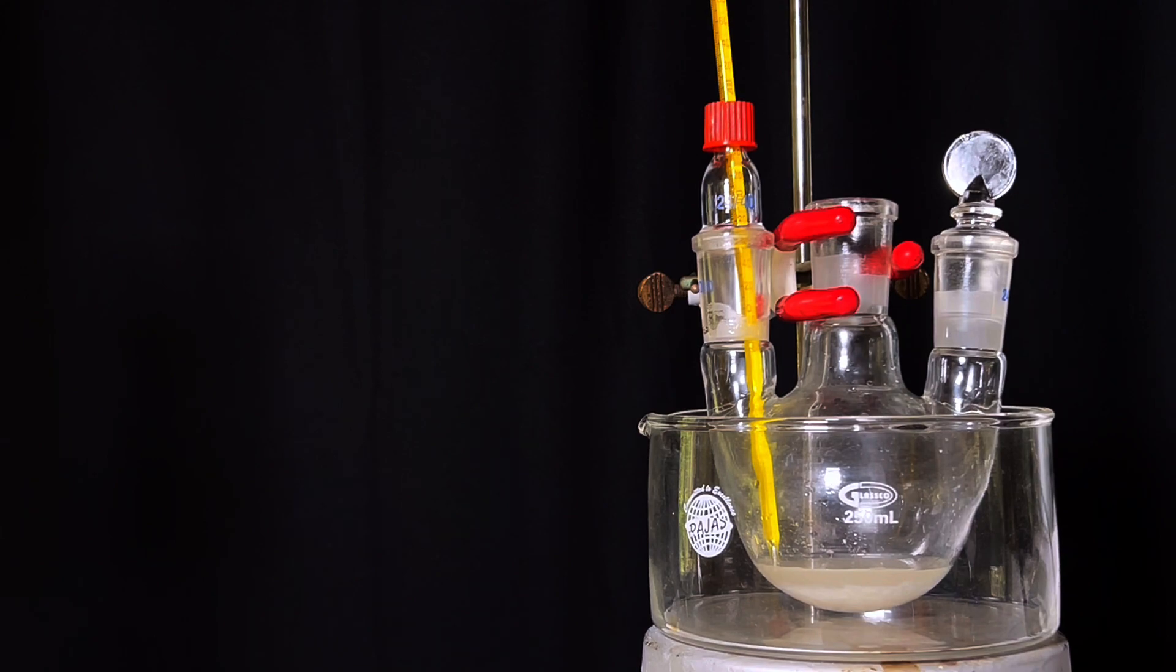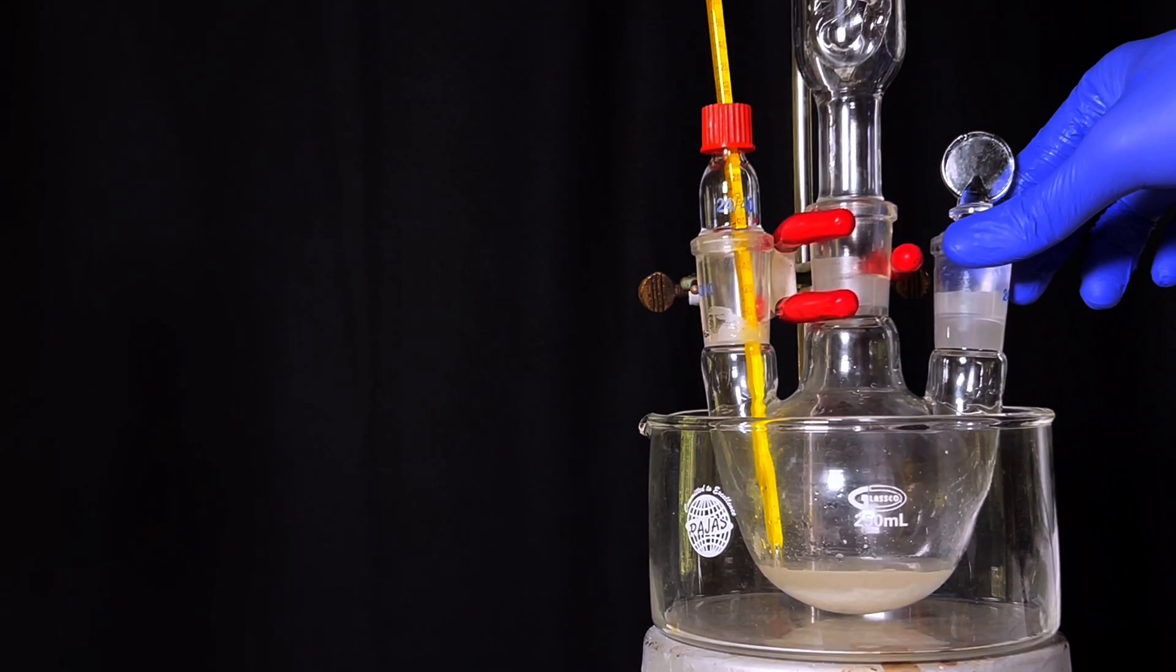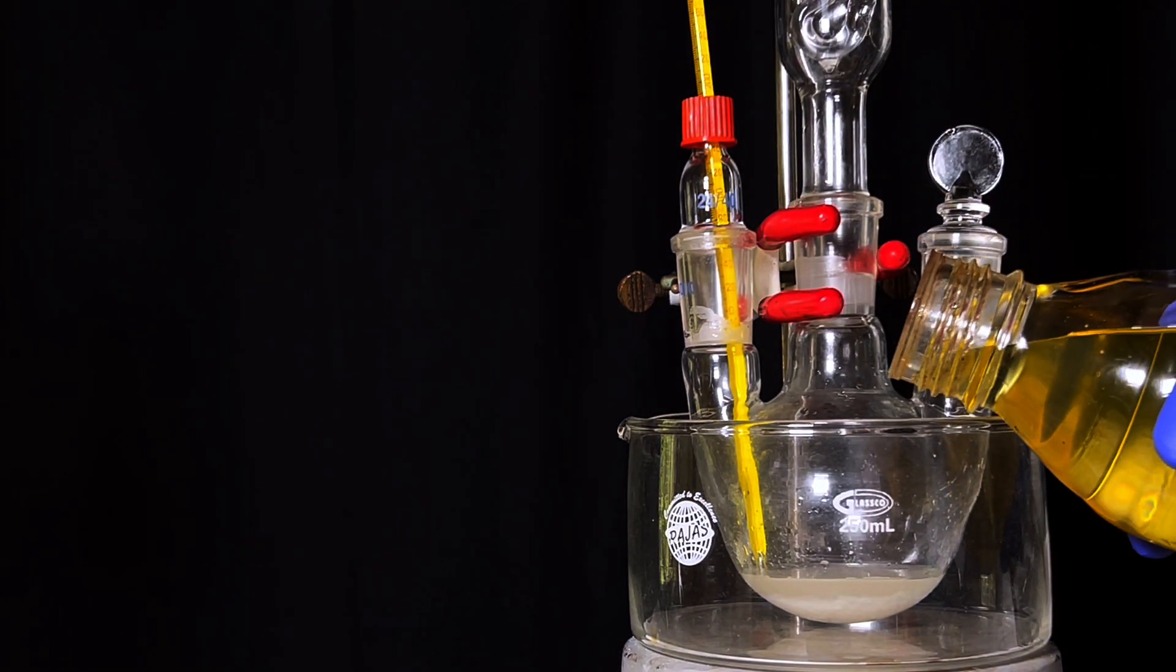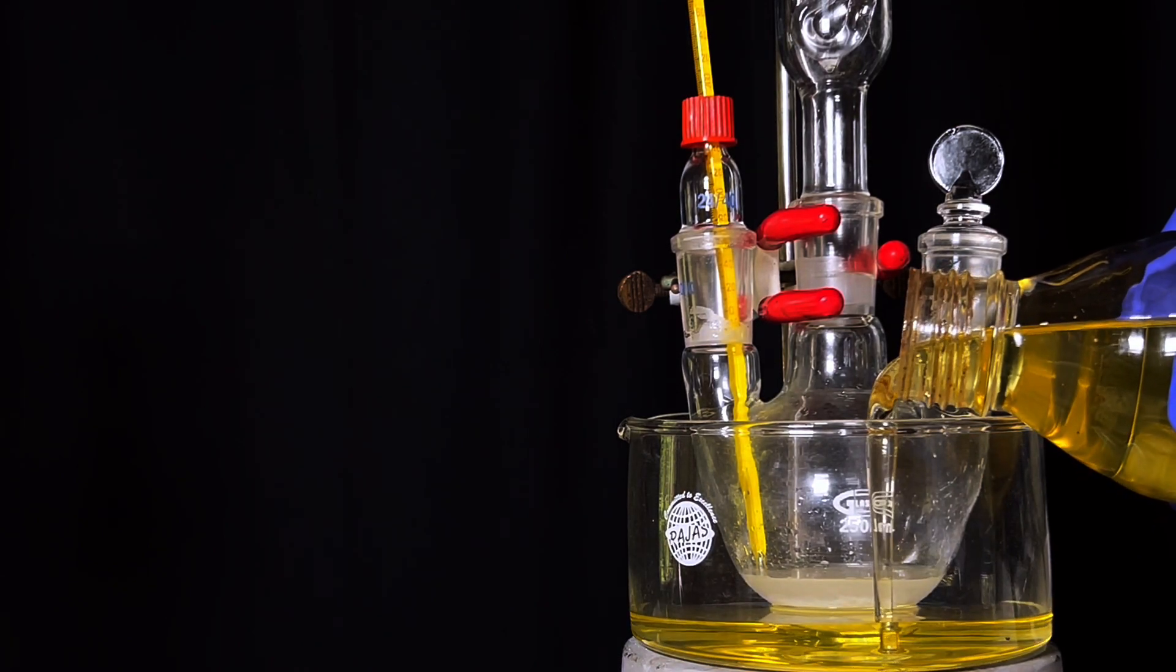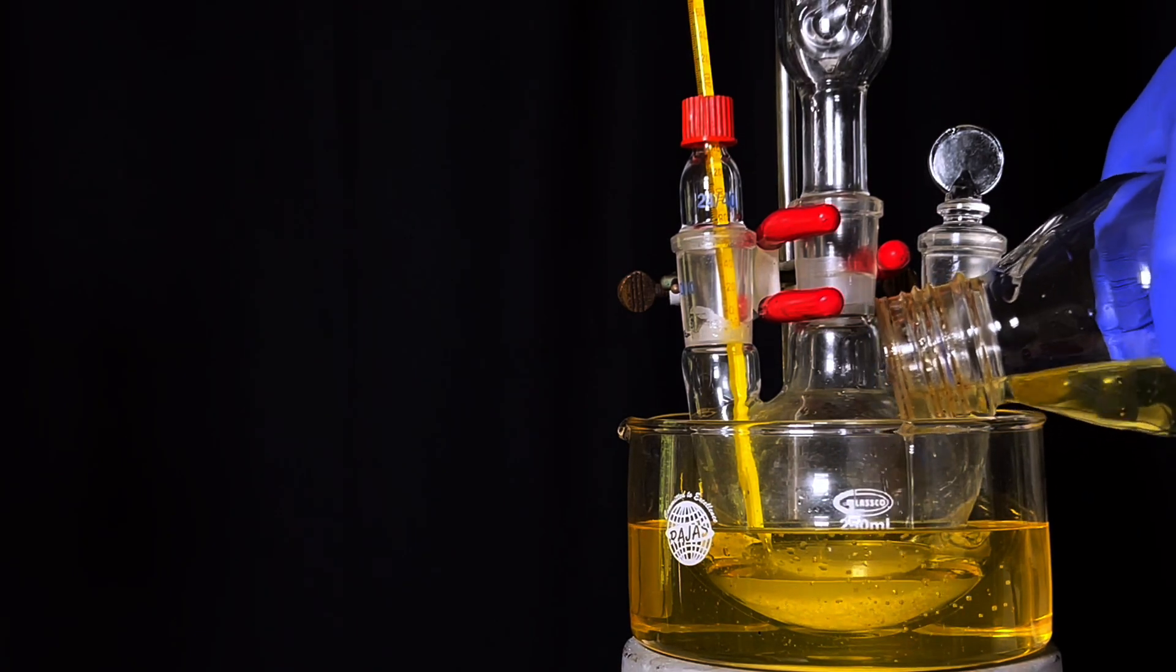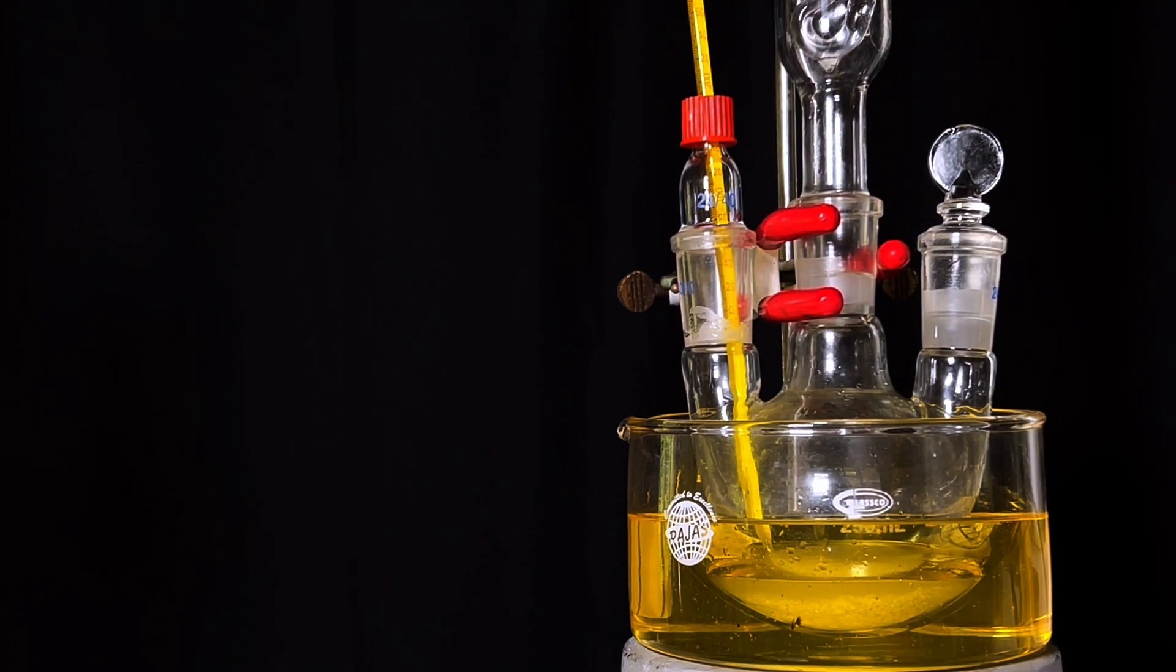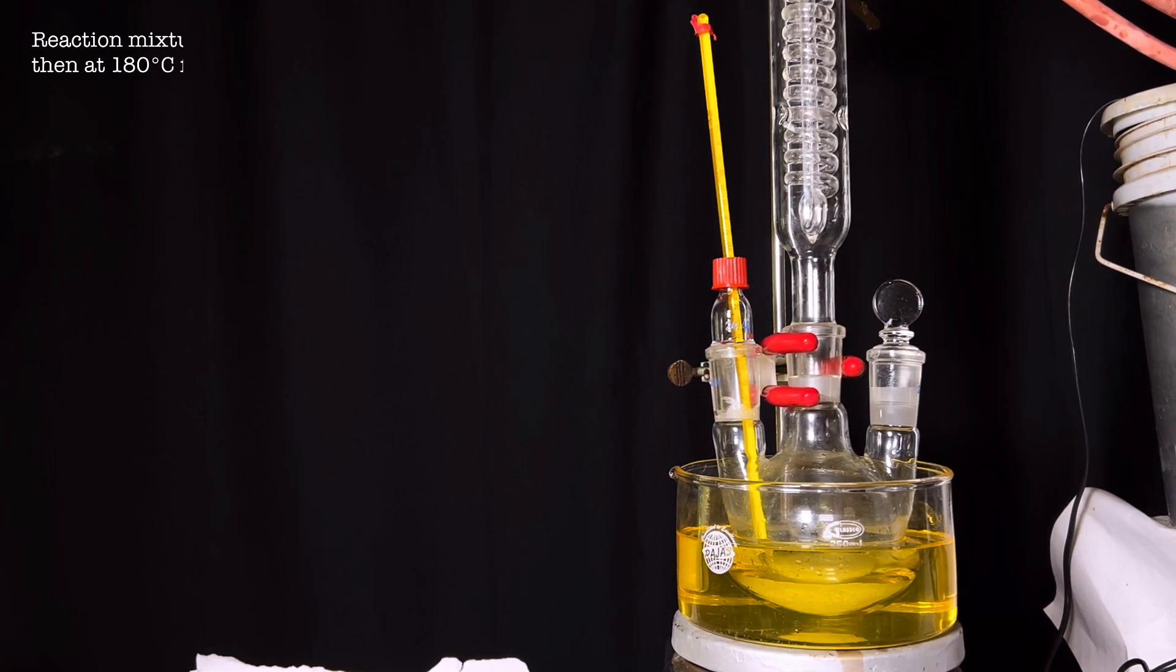A dimroth condenser was attached to the center neck. Liquid paraffin was poured into the crystallizing dish to create an oil bath.